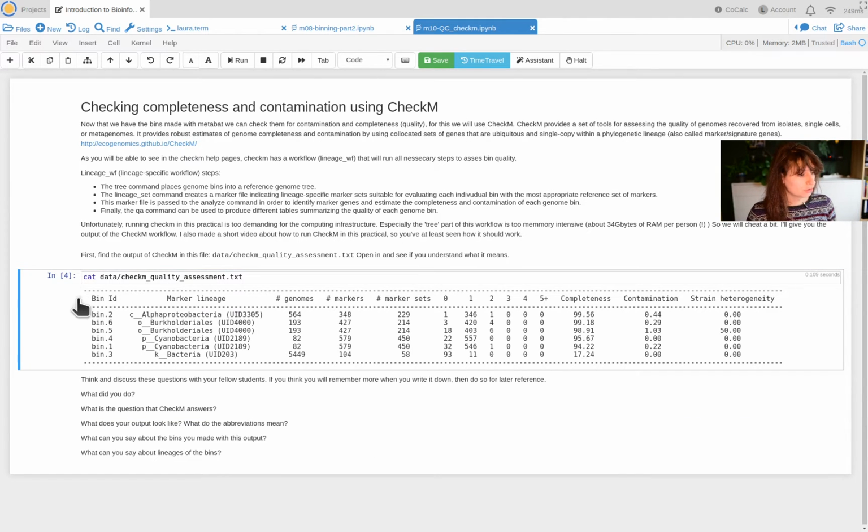I made the letters a bit smaller so the entire table fits on here, but feel free to make the video full screen so you can read along. So what do we have here? We have the different bins. Those are the rows in this table. There's the marker lineage that was inferred in this very memory intensive step. So we have an alpha proteobacteria that's, well, now I have a blackout. Okay, never mind. We have an order, those are Burkholderiales. We have a phylum, those are cyanobacteria, and even the kingdom, that's on the bacteria level.